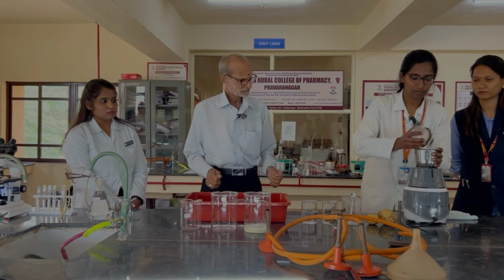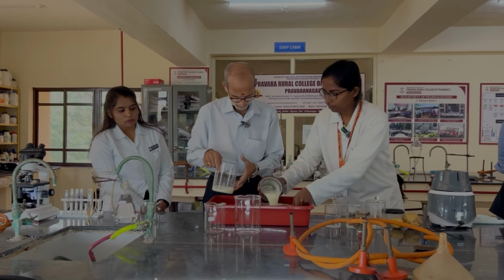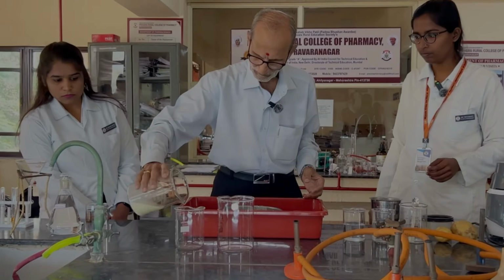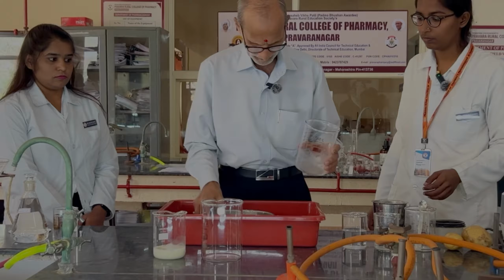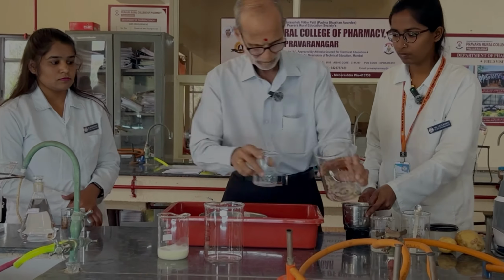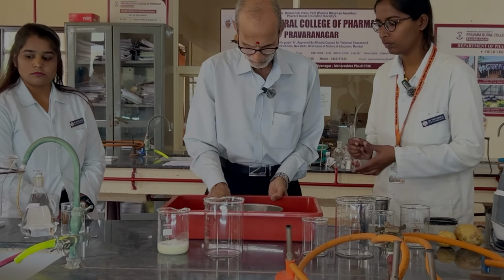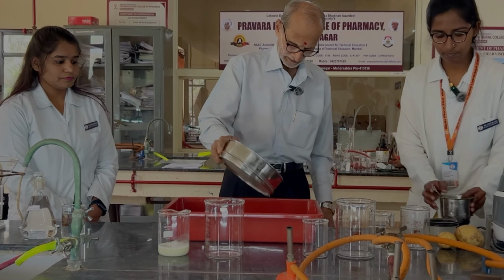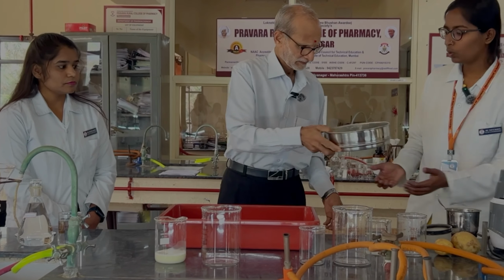Put it in this. We will discard this now. Discard it.